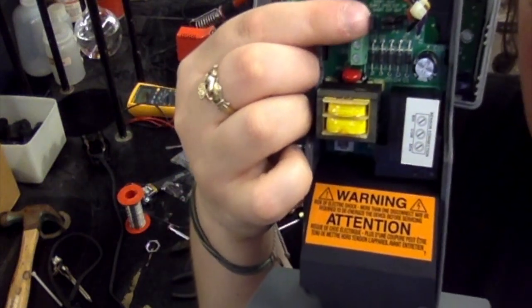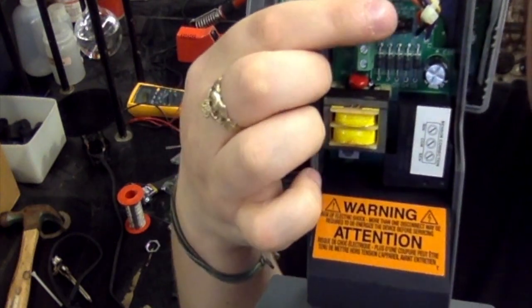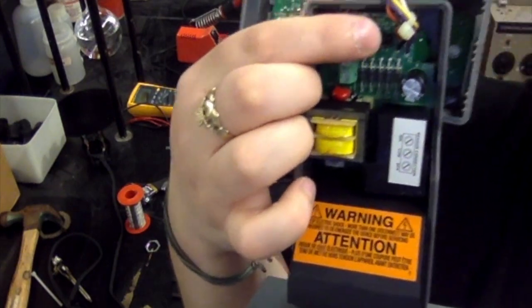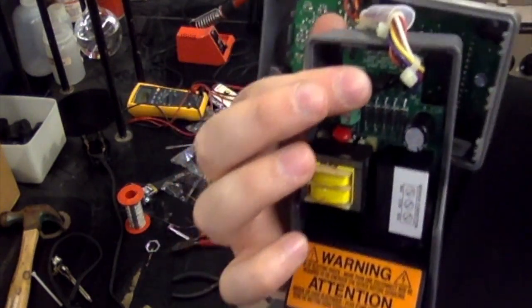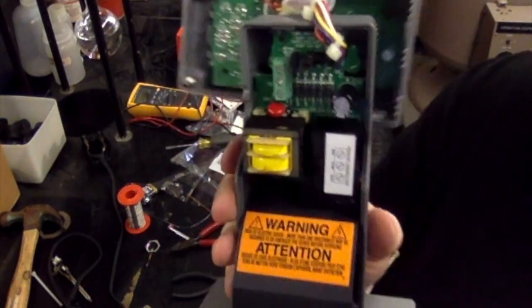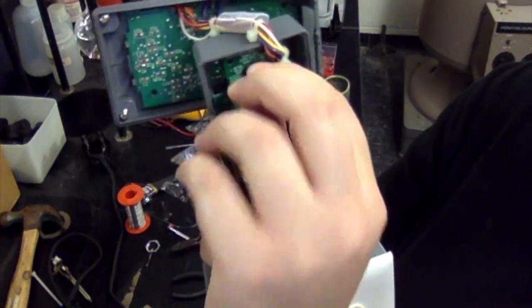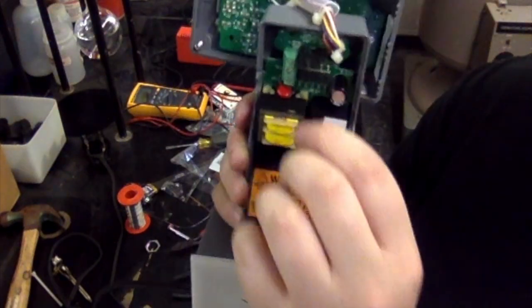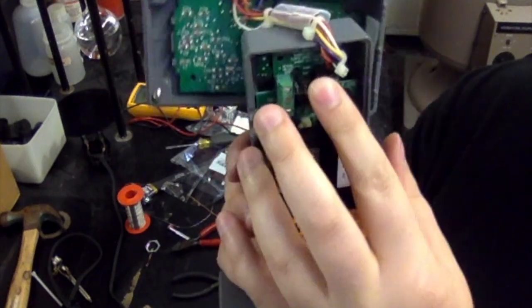Basically, this one right here is going to stay the same, and these 2 parallel ones need to move. So these covers are only covering 1 prong each, but if you'll notice, just to the right, there'll be 2 prongs that aren't covered. For this to be the heating configuration, we need all of those prongs to be covered. So to do that, you're just going to remove these covers by pulling straight up. It's important that you pull straight up. You can see it kind of pulled it out a little bit. You're going to pull straight up and simply move it over so that it's covering 2 prongs, okay?